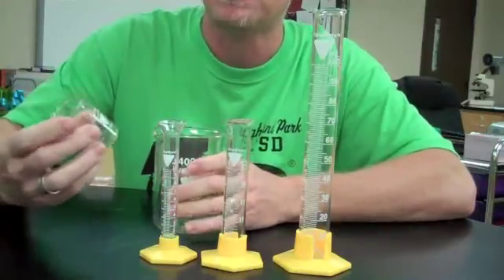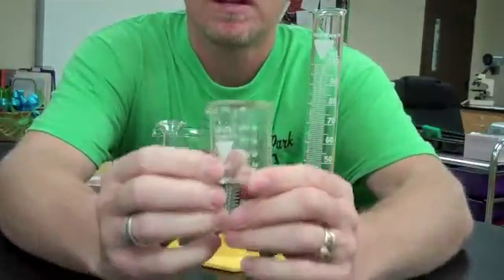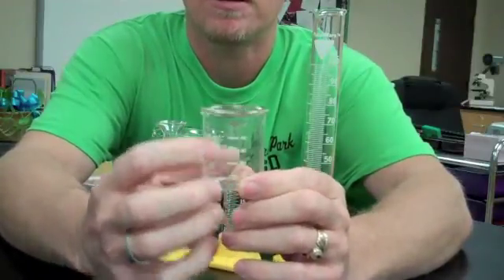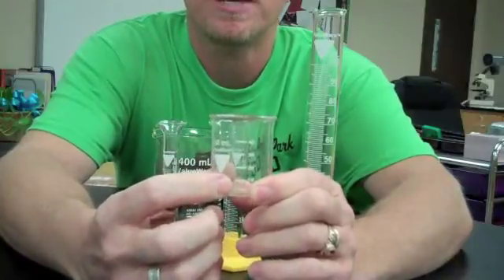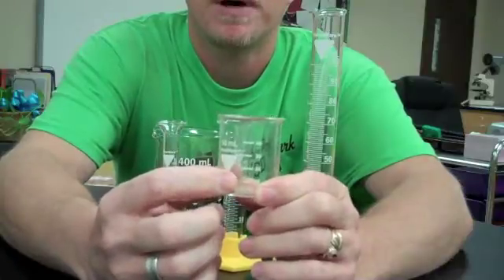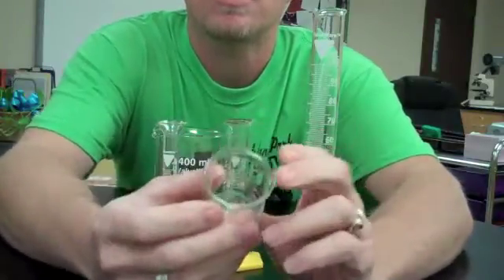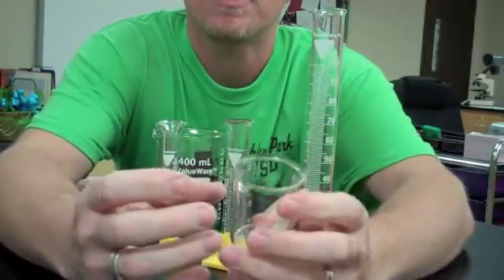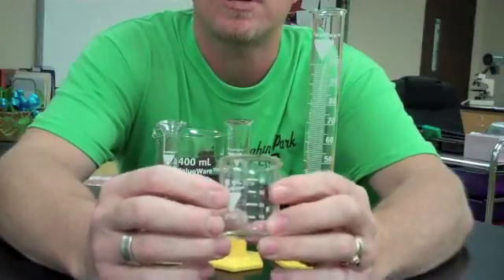What I want to explain is that in this beaker, the first line starts at 10 milliliters and it goes all the way up to 40. As long as we hit one of those lines, we're pretty accurate and somewhat precise. But depending on how large the volume of the container is, it can create discrepancies or differences in what you're really trying to measure.